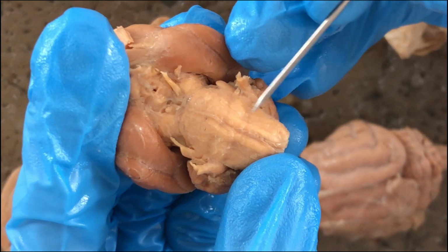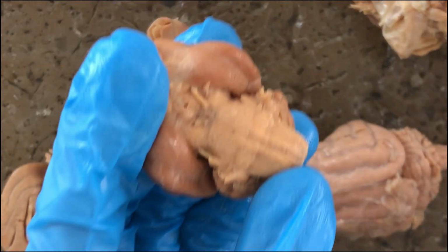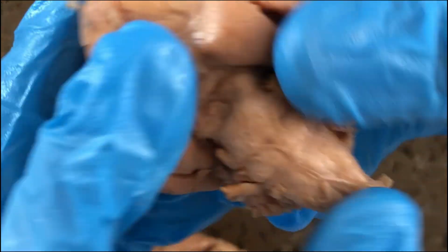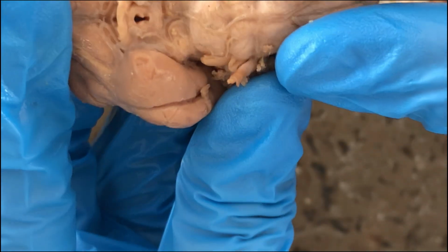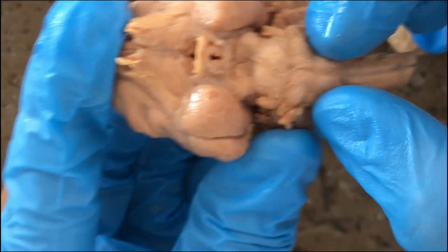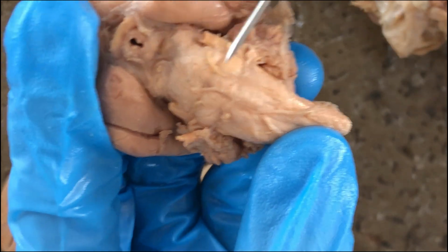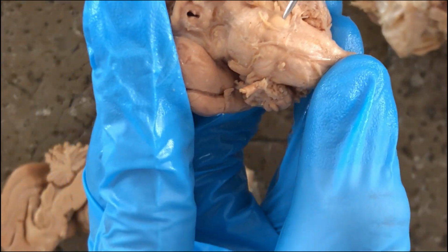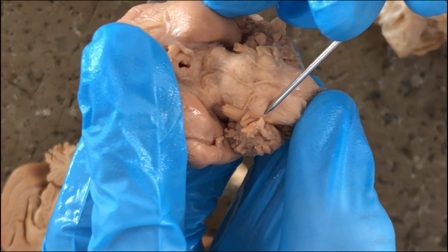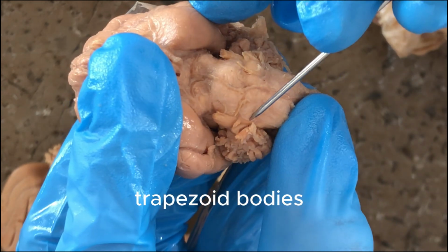And then if you move more posteriorly, you'll reach the part of the hindbrain called the myelencephalon. And the myelencephalon consists of the medulla oblongata, which has subparts. So these lateral bulges here, posterior to the pons, would be the trapezoid bodies.